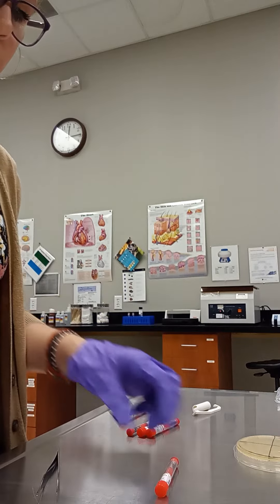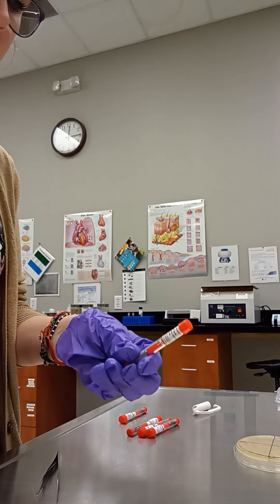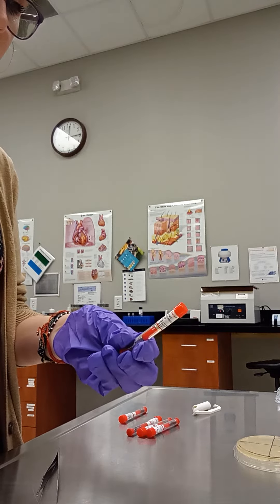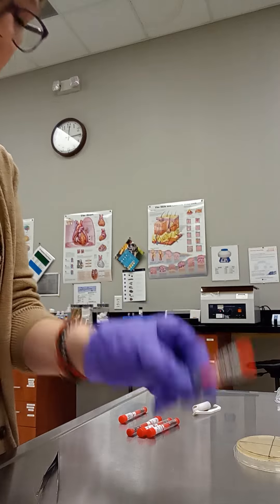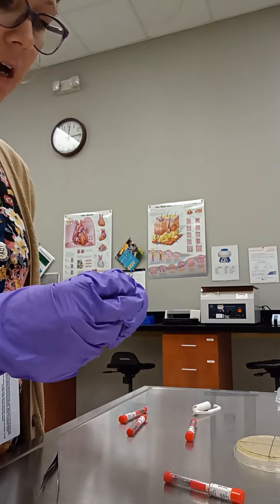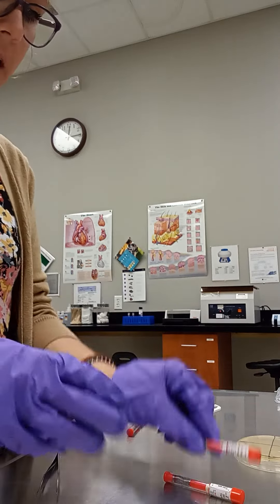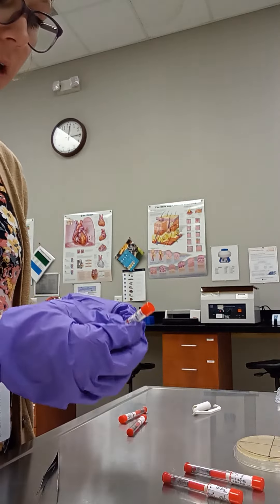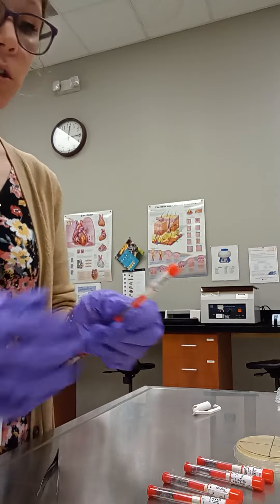We have tetracycline in this one, streptomycin here, we also have neomycin, erythromycin, and penicillin.